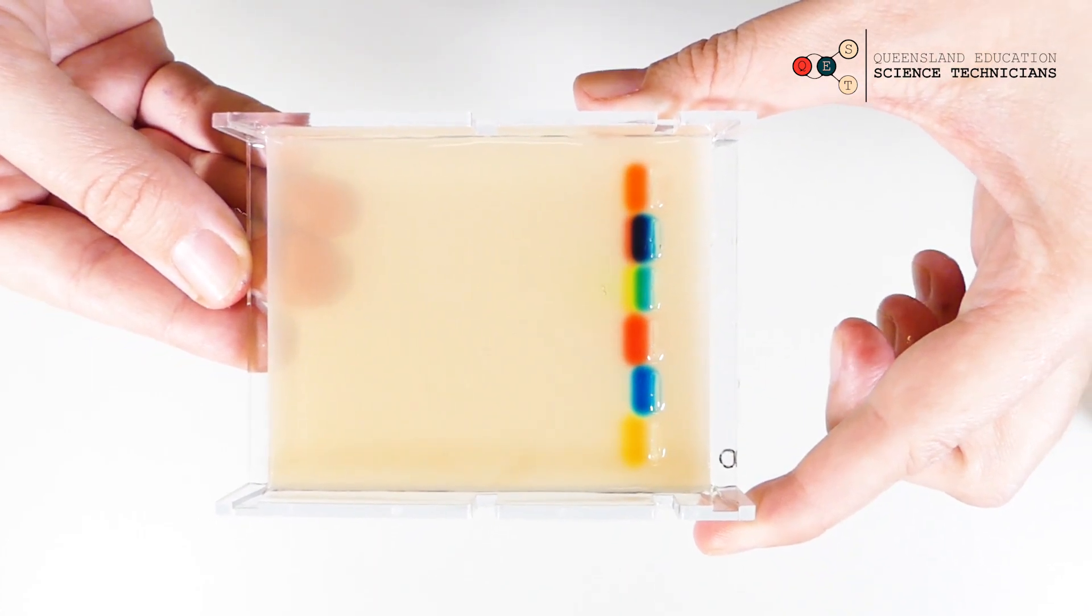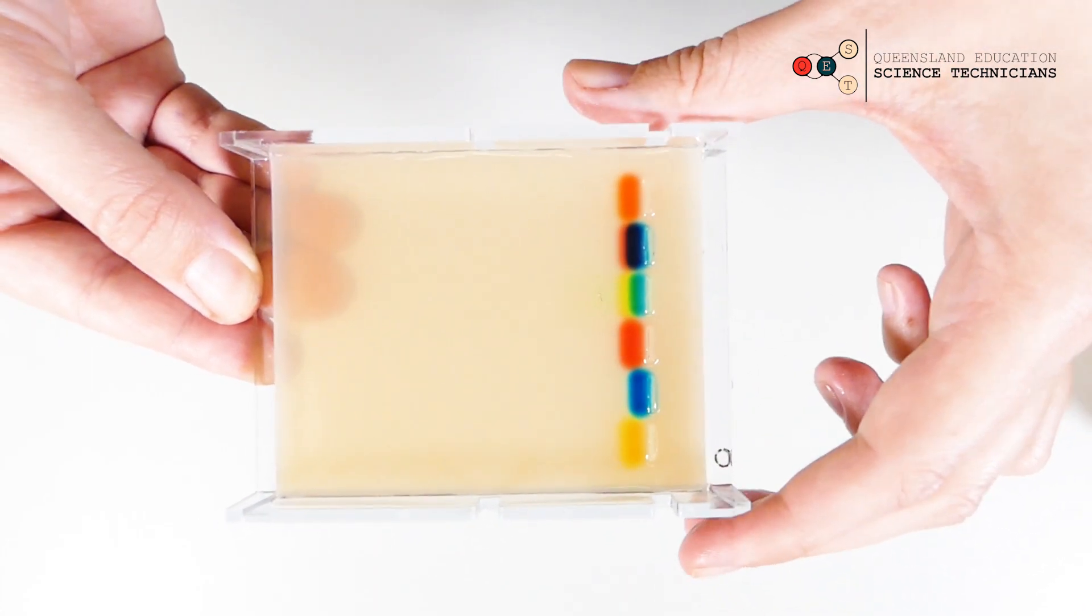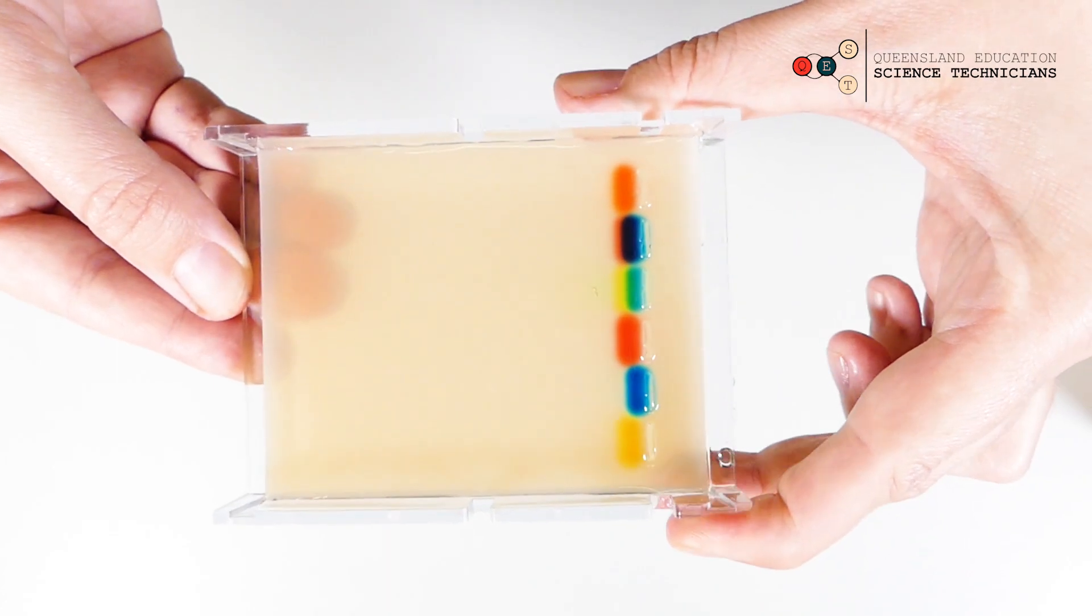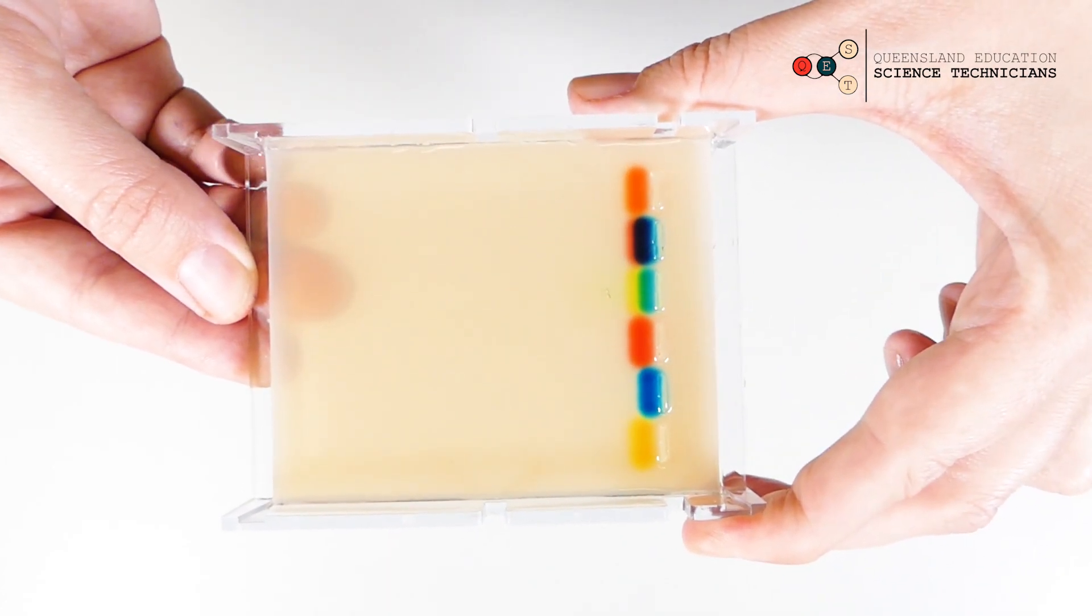The longer you let it run, the further they'll go through. If we let it go for another 20 minutes or so, they'd probably be pretty close to the end of the gel.